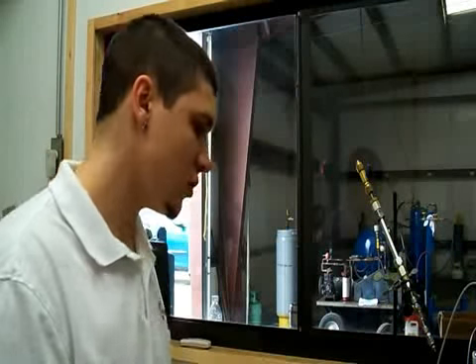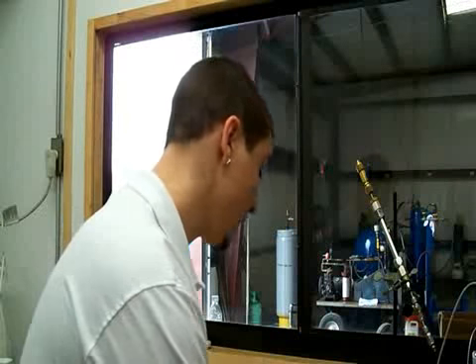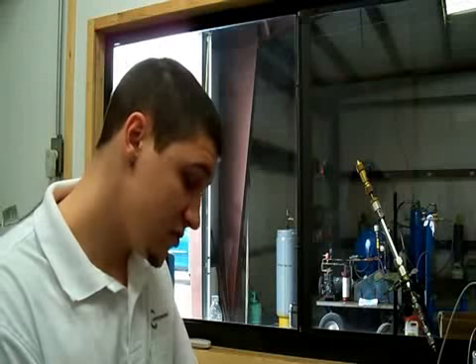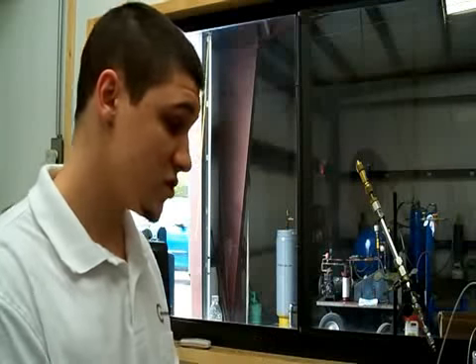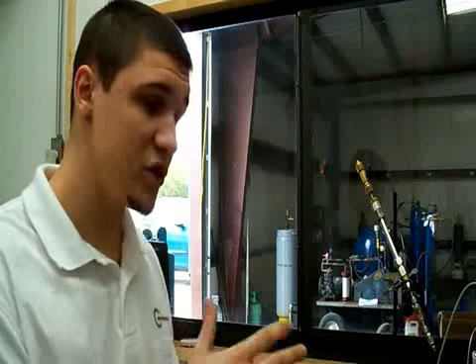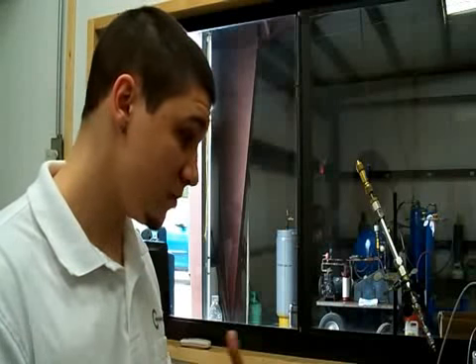Well, as I said, we refer back to the 4 points. We have a non-condensable sample, we have a moisture sample, we have a purity, and we have an oil, high boiling residue. There's a set of guidelines by InterTeck, the company that we send our samples to, and they give us guidelines as to where we should be under. So we send our sample out hoping to be under that, which we always are. So you send the sample in what? What do you send it in?